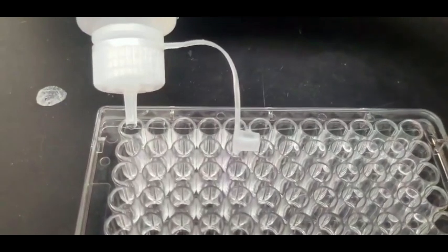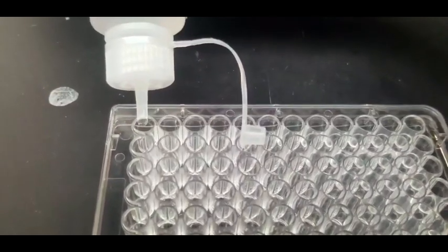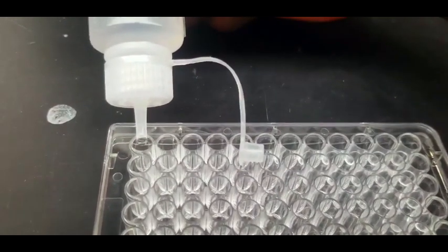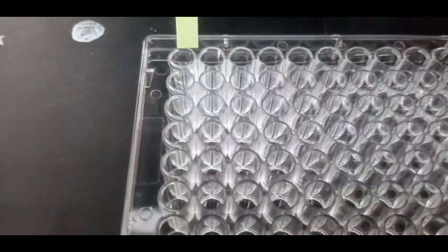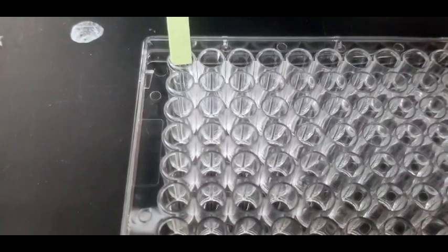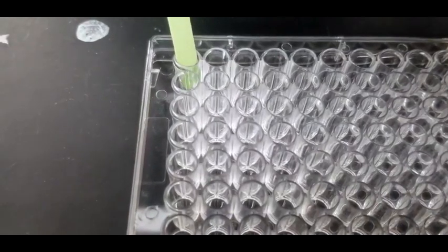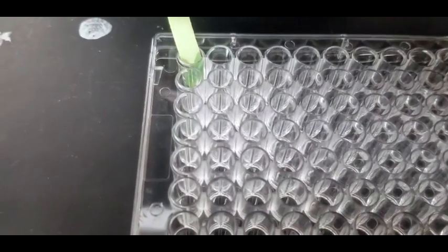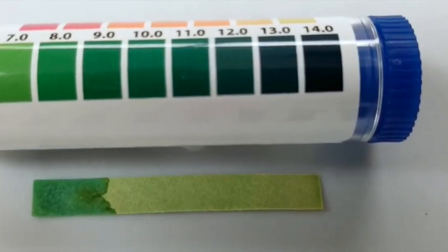Then, distribute the solutions into the provided micro well and obtain and use the pH paper and dip it into each solution, observe the color of the pH paper, and record your results.